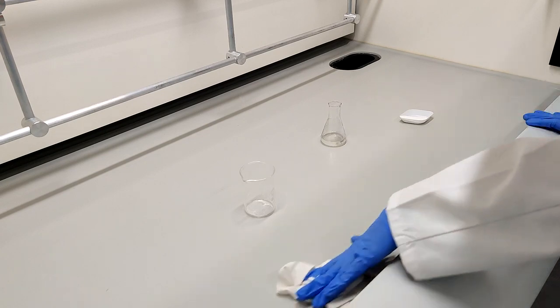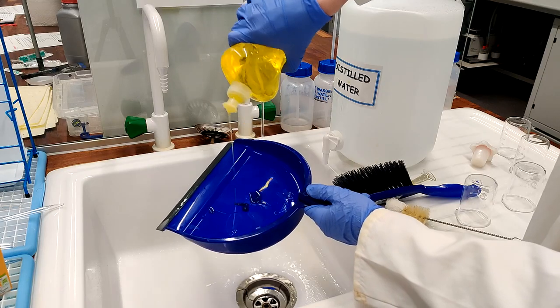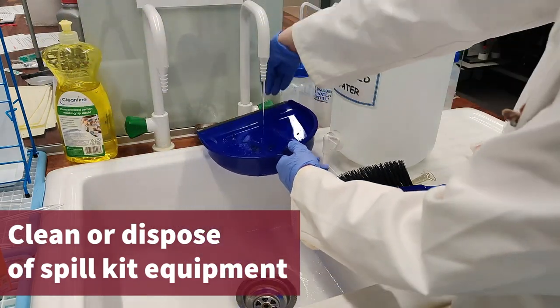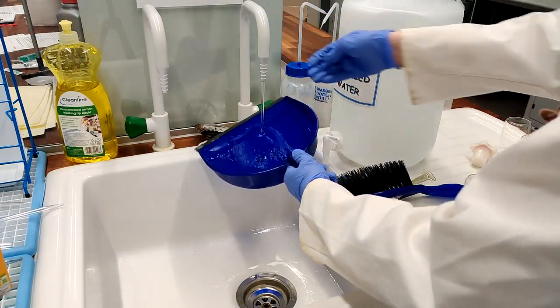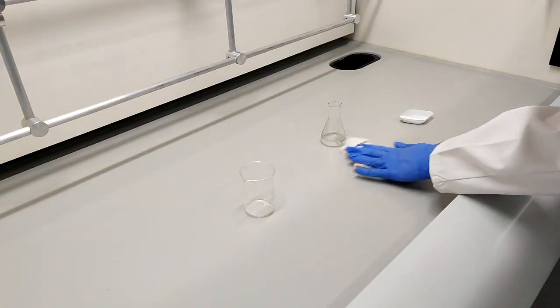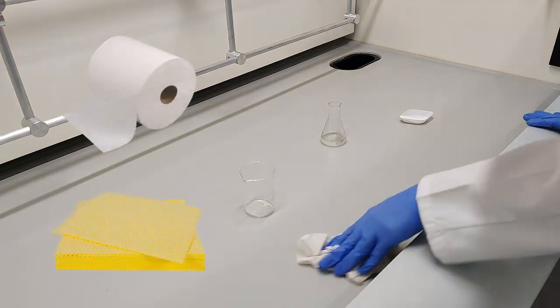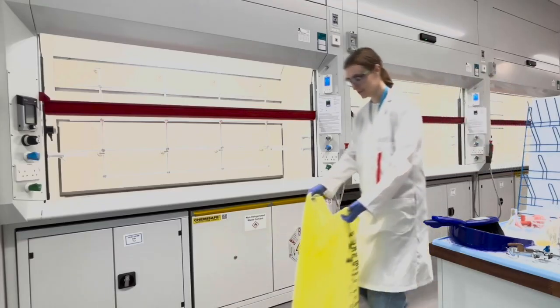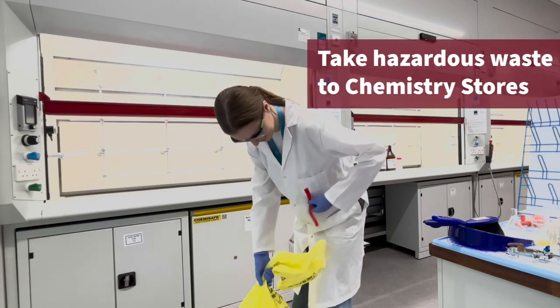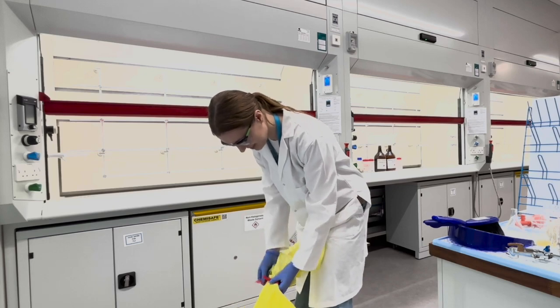Contaminated paper towel and gloves should also be disposed of in the yellow hazardous waste bag. If possible, clean the dustpan and brush before returning them to the spill kit. Otherwise, dispose of them in the yellow hazardous waste bag and replace with new ones from chemistry stores. To deal with moist solids or materials that cannot easily be swept up, use an absorbent such as paper towel or a spill pad and dispose of as before. Once the spill has been cleared, the yellow hazardous waste bags and any waste containers used should be taken to chemistry stores for disposal. Any sealed containers need to be labelled with their contents.